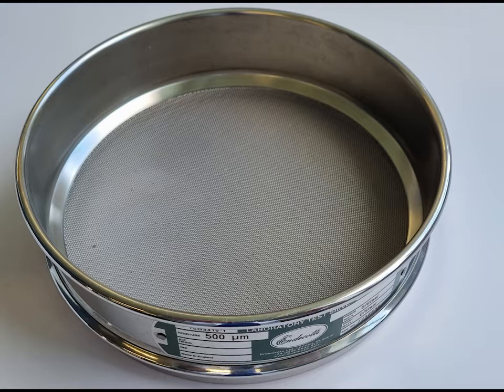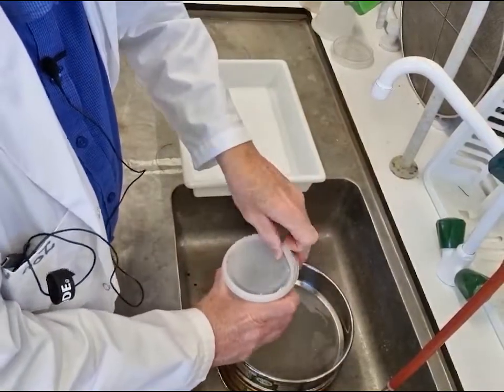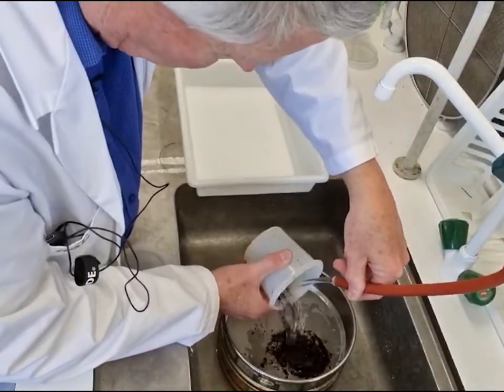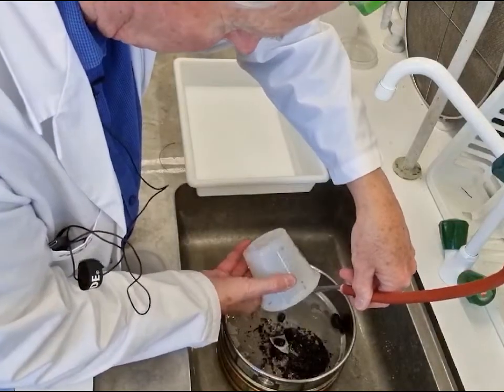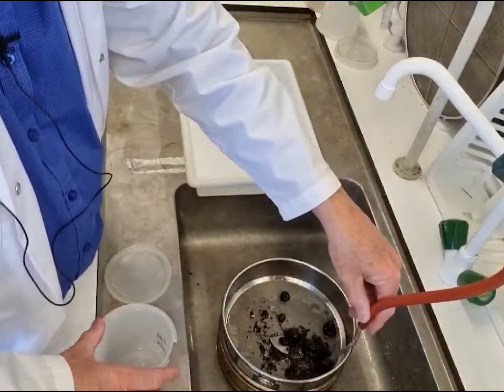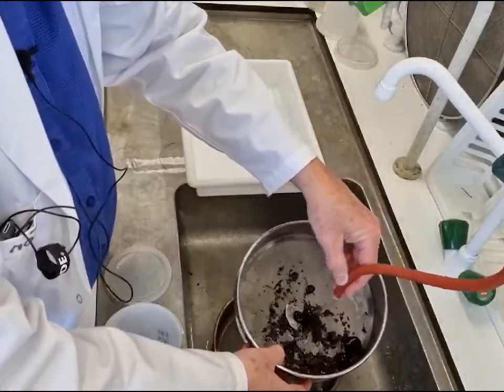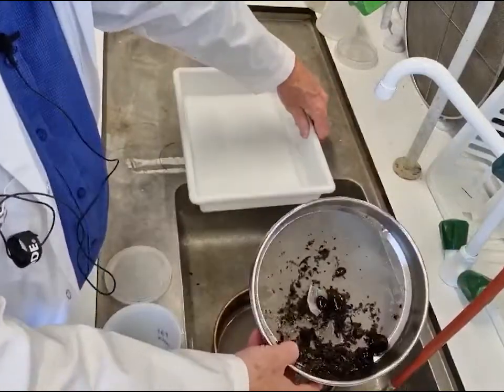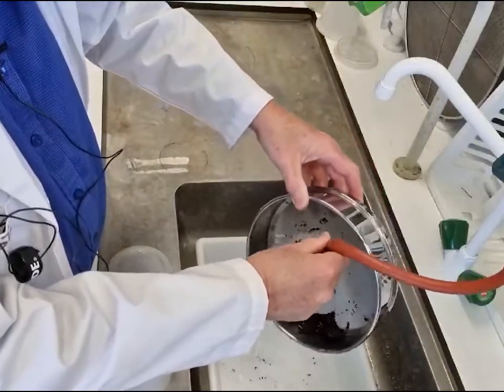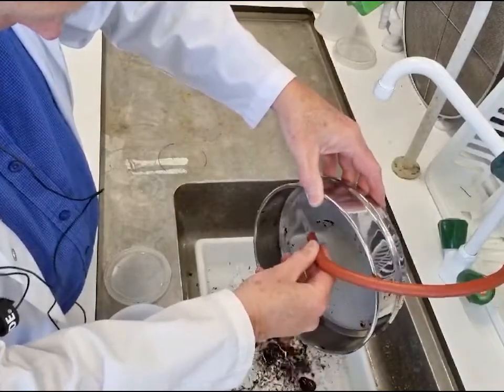You're going to end up bringing your sample back into the laboratory — it's probably in preservatives so you're going to want to wash that out thoroughly into your 500 micron sieve. You might have quite a lot of material in the sample, so it's worth spending quite a bit of time washing the sample, getting rid of really fine material, so you've got something cleaner when it comes to actually picking and sorting the animals. Time spent washing is really time well spent.